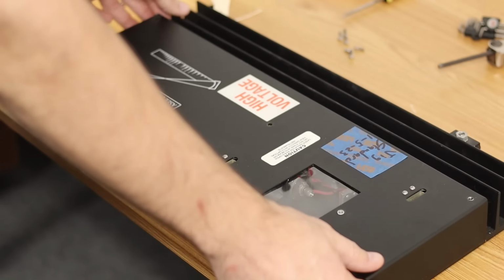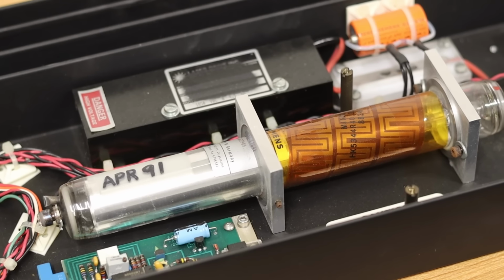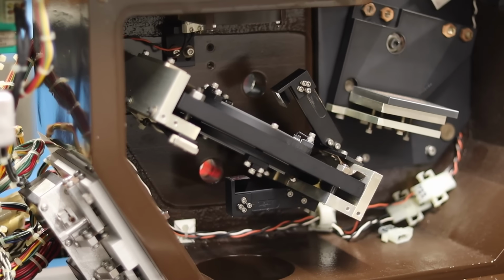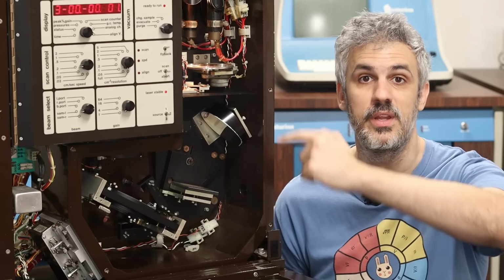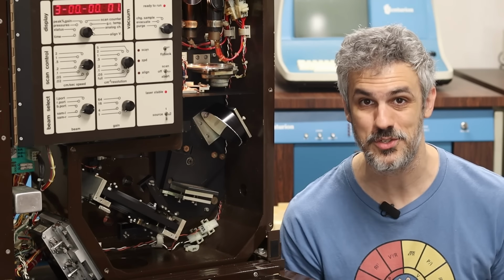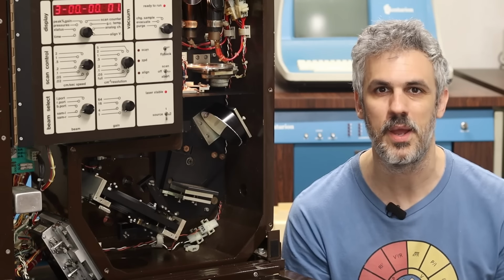The environment in which this laser is being used is that it's in a self-contained box on the back, and so there's no way for the laser to stray out of that box in a way that would potentially strike my eyes. Not only that, the laser is passing through a very well-defined optical path with mirrors that are bolted in place. The only mirror that can move that's within the laser optical path is the mirror that can move vertically here. And that mirror is flat and can only go in one dimension. So there's no way for the mirror to shift in such a way that would cause the laser beam to shift off that optical path and strike my eyes.